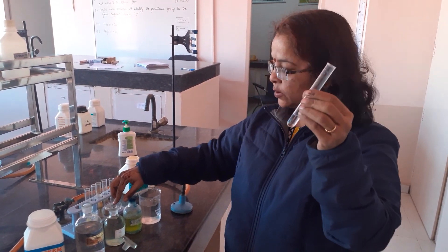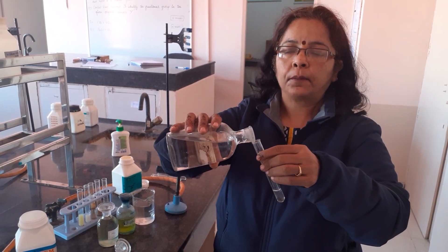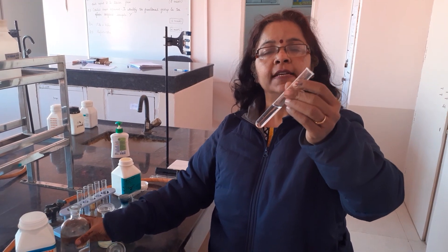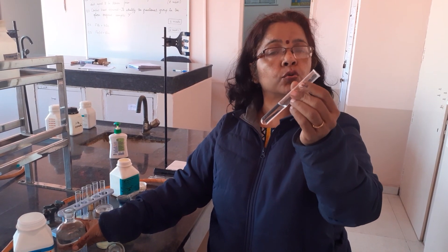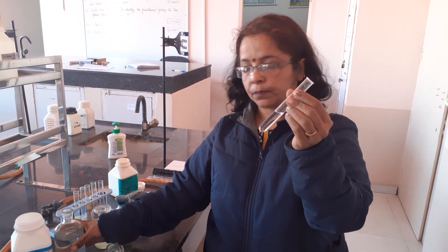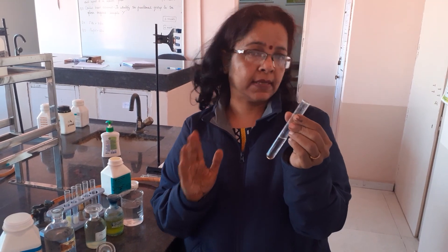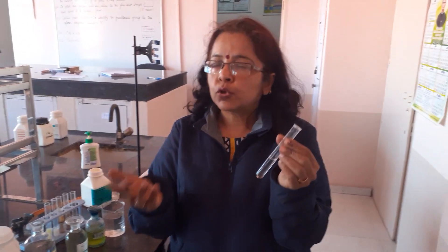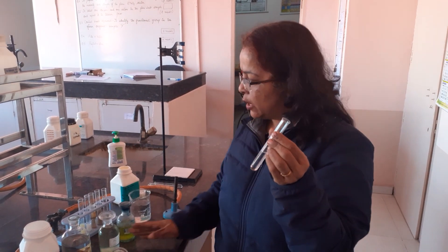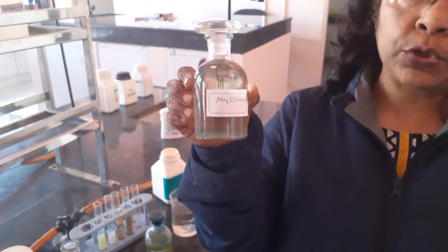To this OS, I add dilute HCl first to check for the presence of group 1. You can see there is no white PPT. Since there is no white PPT, this shows there is no lead in it — that means group 1 is absent. When you proceed for group 2, you are supposed to add H₂S gas, but in most schools these days, due to environmental constraints, you would be using sodium sulfide solution instead.